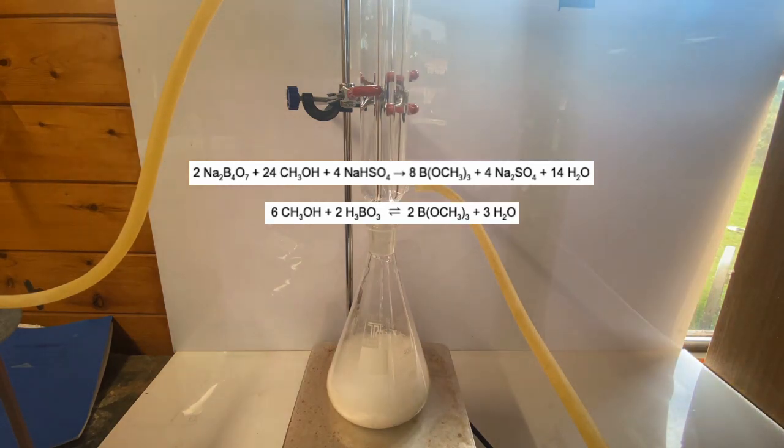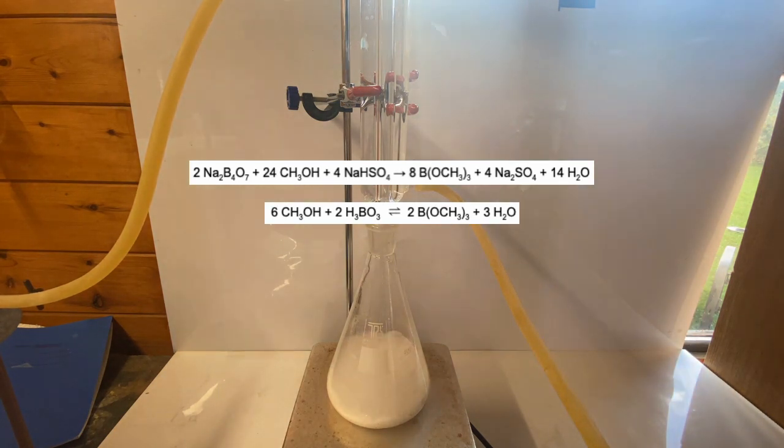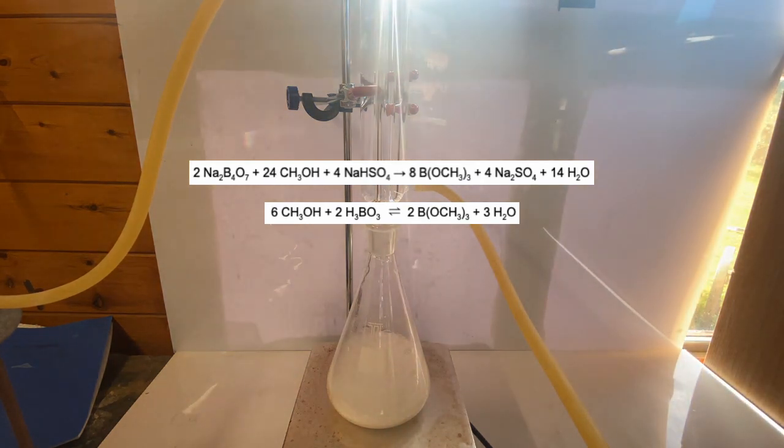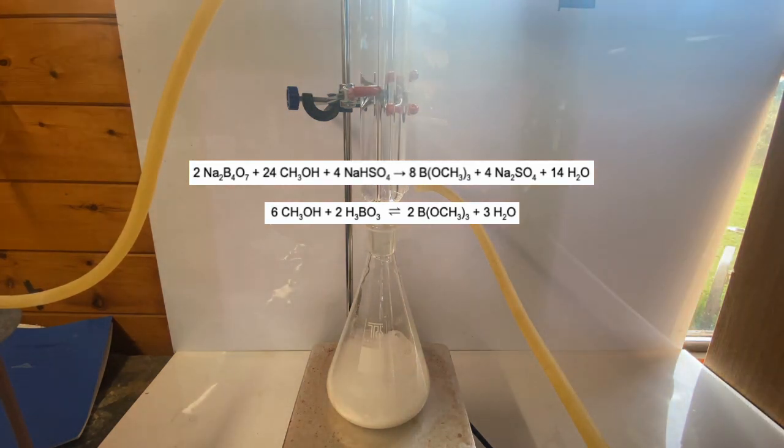Another important thing to note is the equilibrium between methanol and boric acid with trimethyl borate and water. To push this equilibrium in the right direction, it's vital to have the trimethyl borate away from water. This also includes the water in the air.